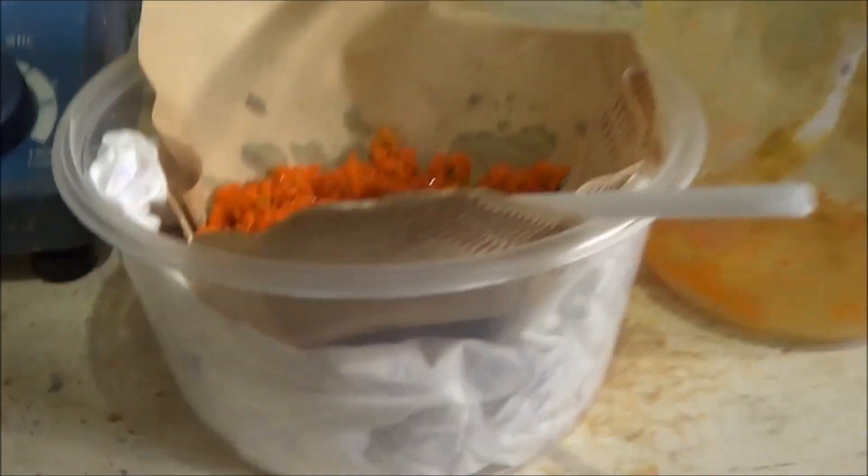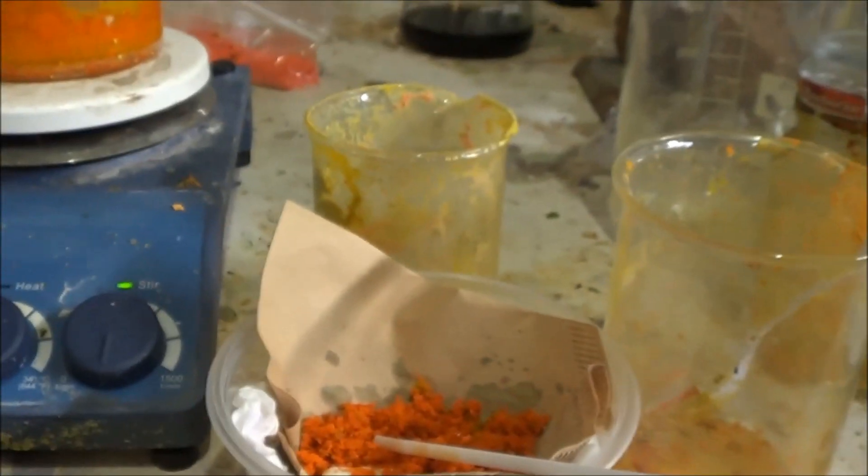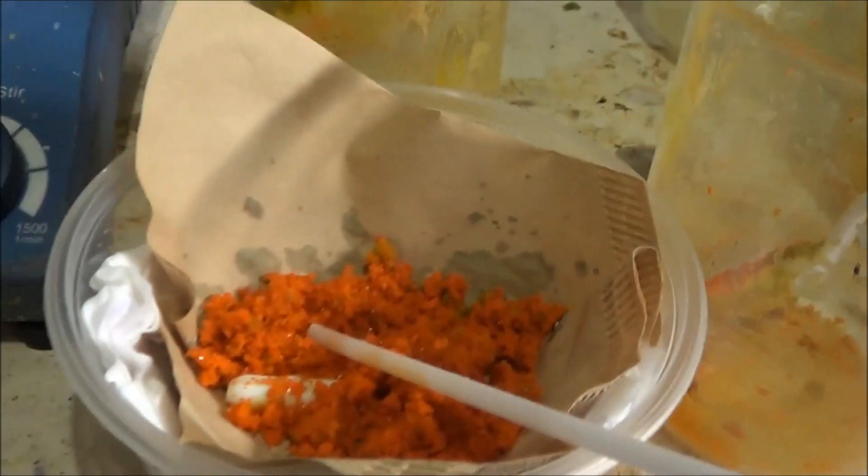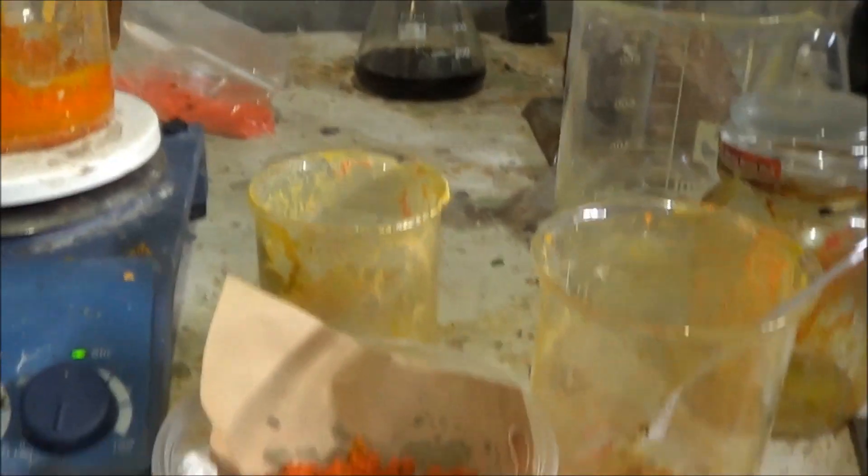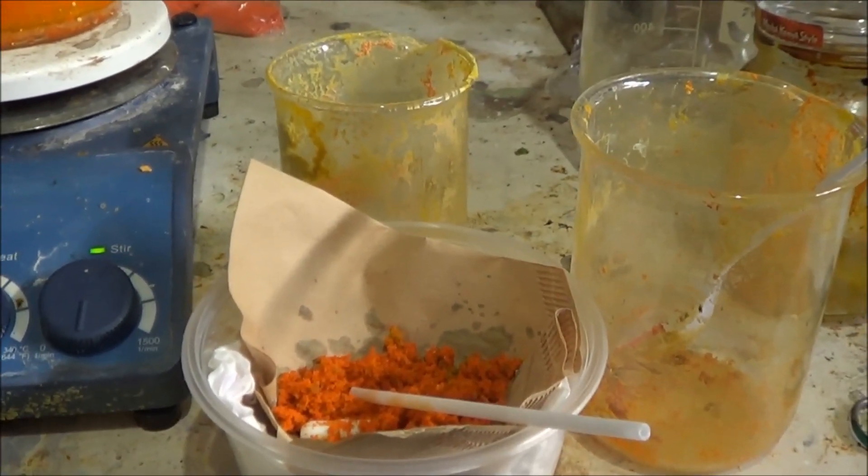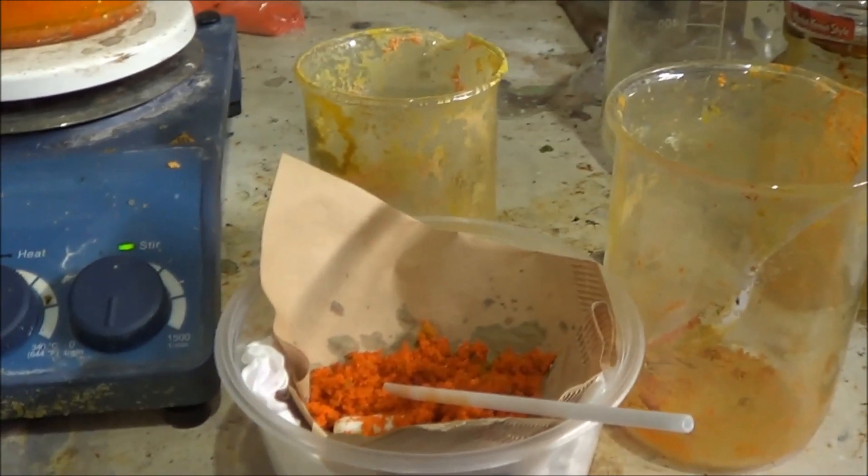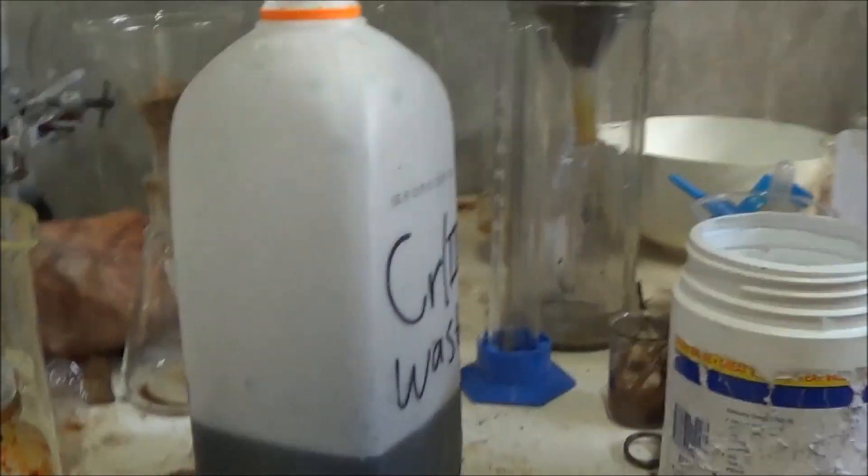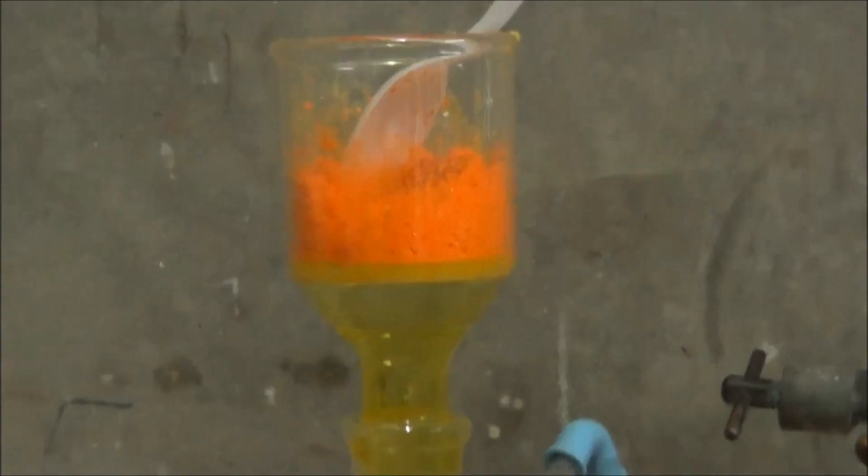So I'll combine these two together. I mean, they're a bit different crystalline grade, which explains a little bit of different color. It's just the crystal structure. But I'll combine them together, let them dry, and put all this chromium waste in temporary storage, like all the rest of the chromium waste.